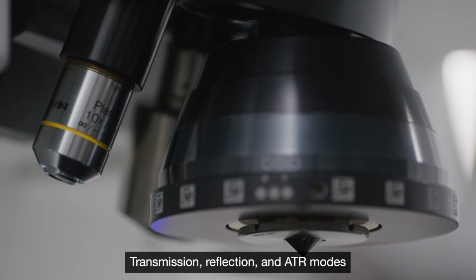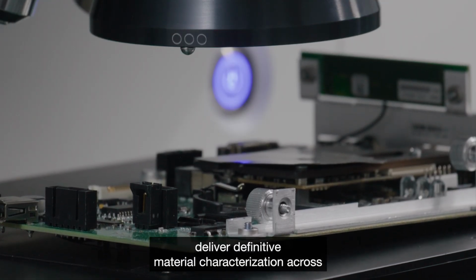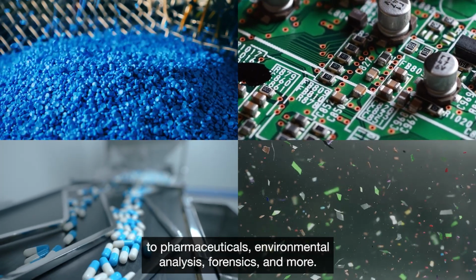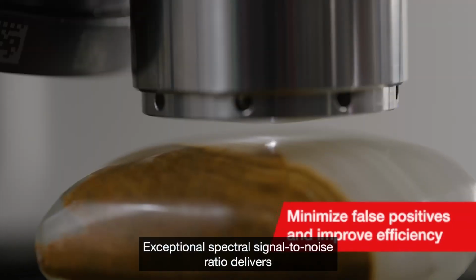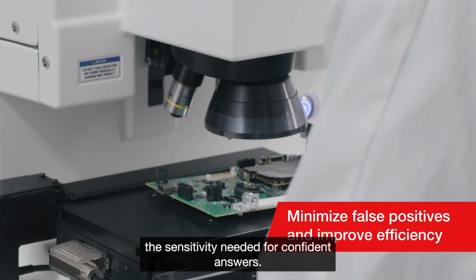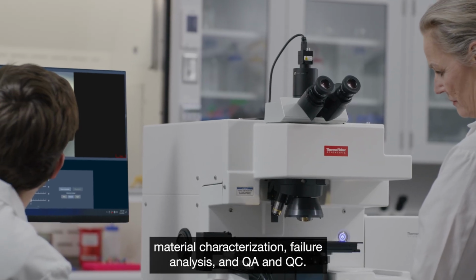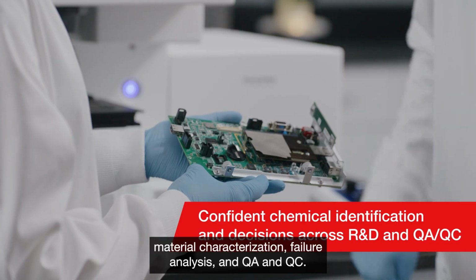Transmission, reflection, and ATR modes deliver definitive material characterization across a wide range of applications, from polymers and electronics to pharmaceuticals, environmental analysis, forensics, and more. Exceptional spectral signal-to-noise ratio delivers the sensitivity needed for confident answers. The Nicolet RaptIR's technology is trusted for research and development, material characterization, failure analysis, and QA and QC.